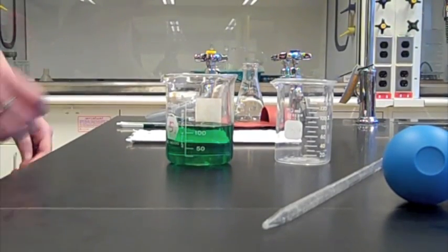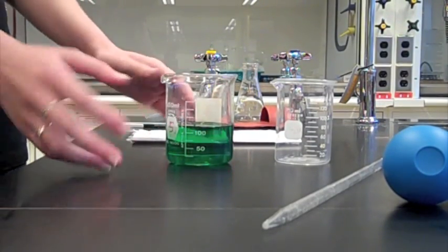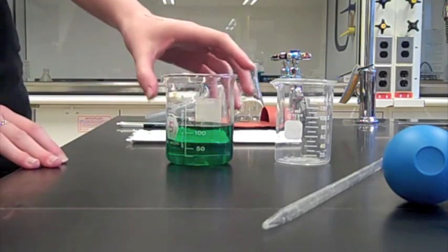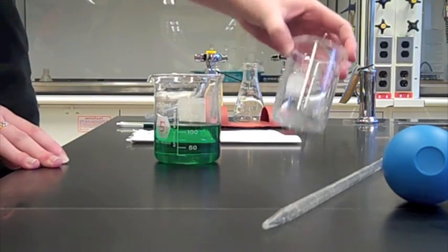How to pipette. Oh no! What am I going to do? I need to get five milliliters of this solution into this beaker.